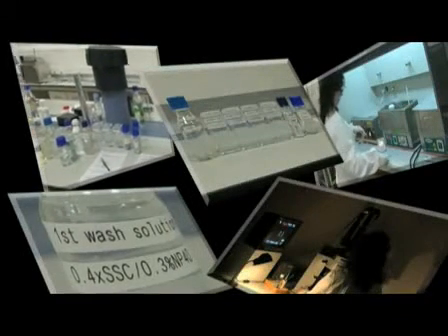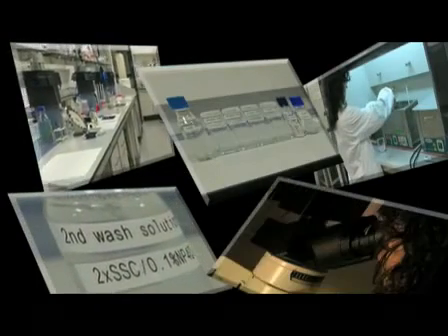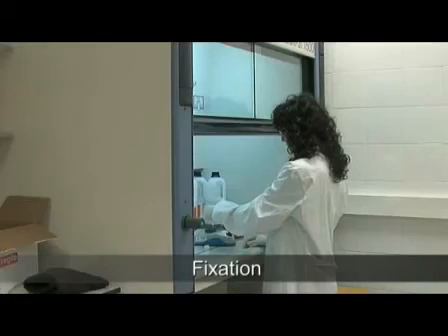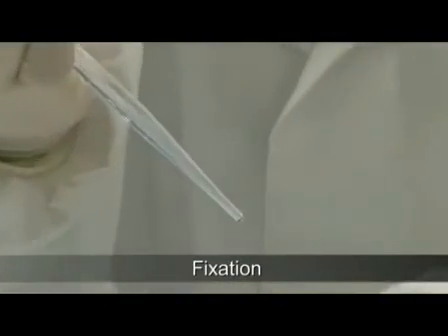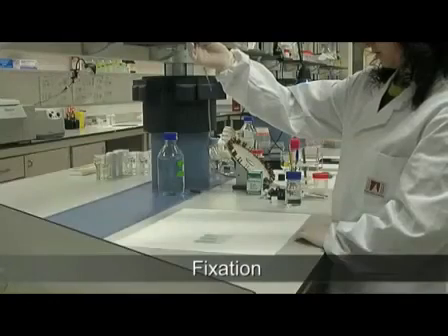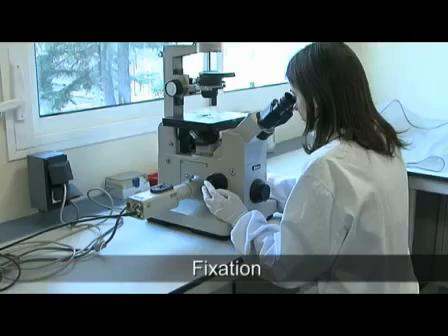So, to sum up, here are the main stages of the protocol again. The fixation process should be accurately carried out to obtain good quality extensions, with a drop-by-drop addition of the methanol acetic acid to avoid the formation of sperm aggregates.